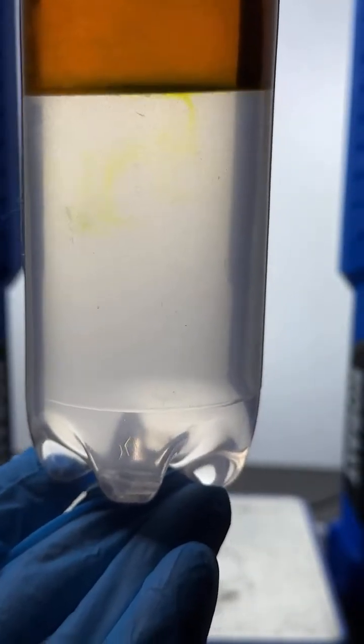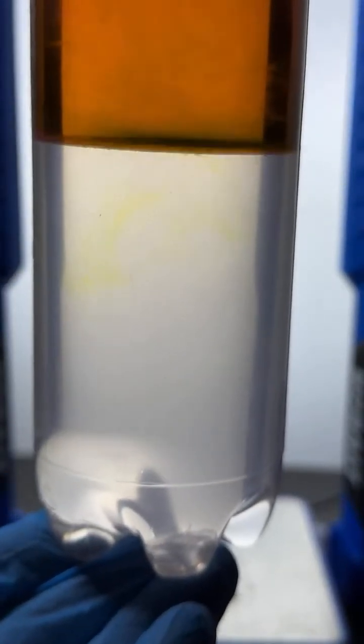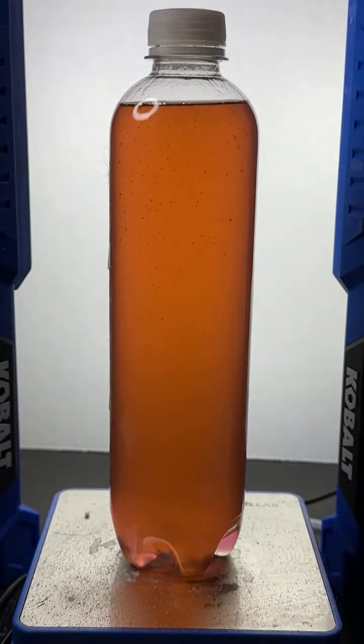It looks like, my guess is, because I can see evidence of it happening, when I shake this up, we're going to get a fair amount of yellow dye in the bottom. And that makes sense because green is going to have some of that yellow dye in it. That's the way they make the green dye. Here we go. We'll shake it up. We'll see if I'm full of crap, and we'll see if my prediction is correct. Let's see what happens.